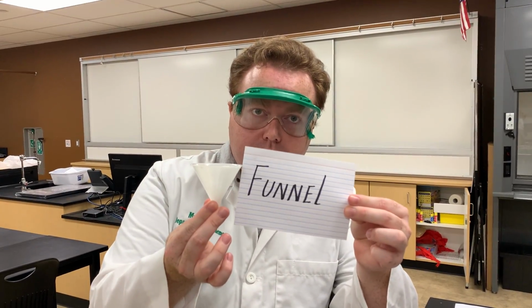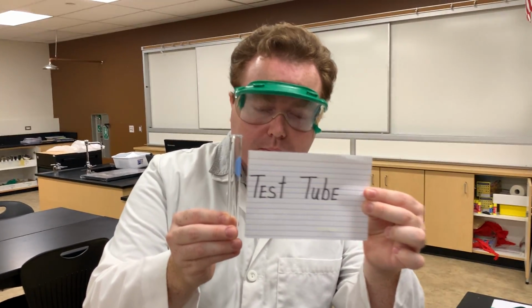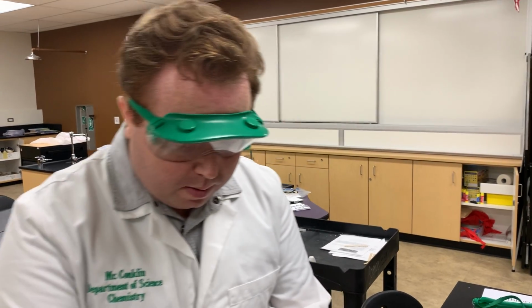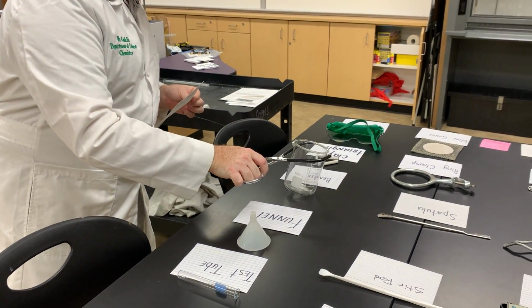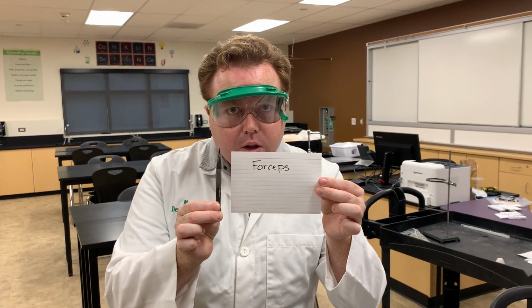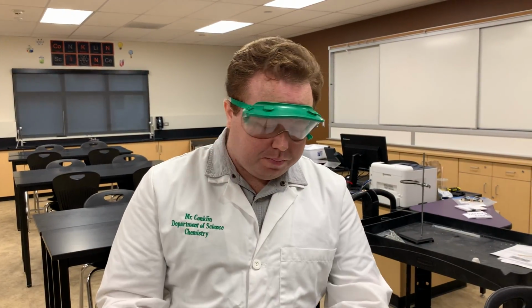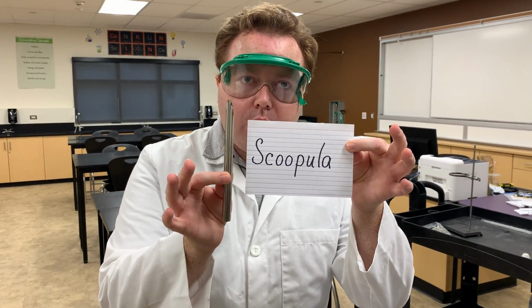The funnel, what we use to control the pouring of liquids. The test tube is what we can use to do small reactions in. The beaker tongs, we use these to hold hot beakers. You grab them like this, and you transport them around. The forceps, you probably use these a lot in biology. We won't be using these much in chemistry, but these are used to grab small granules. The scoopula is what we use to scoop out things and weigh them out onto the scale.